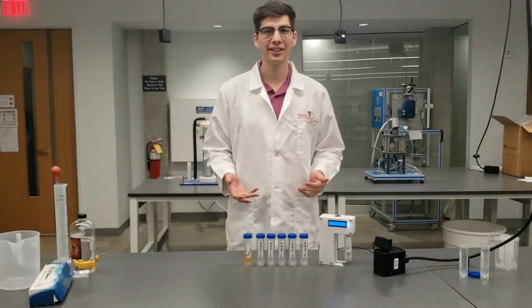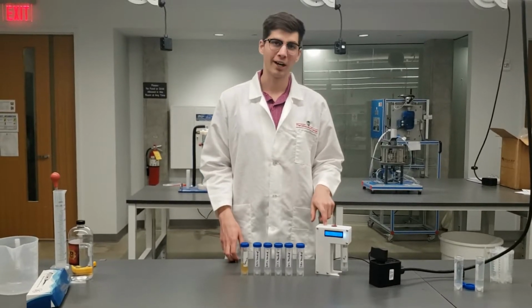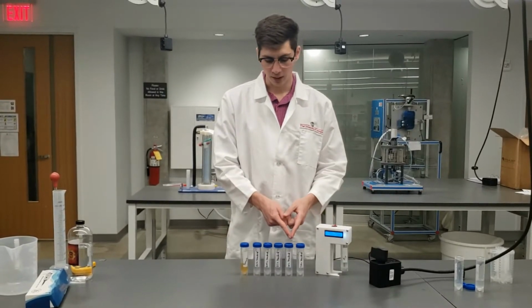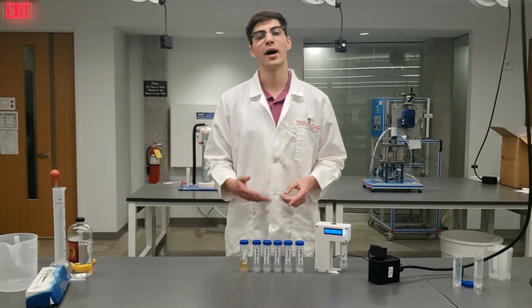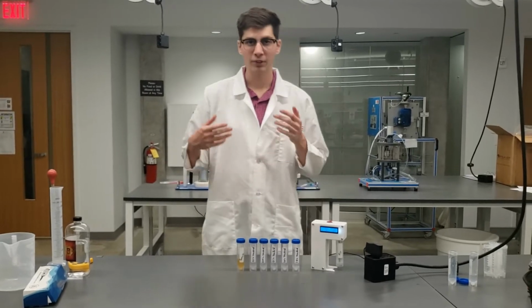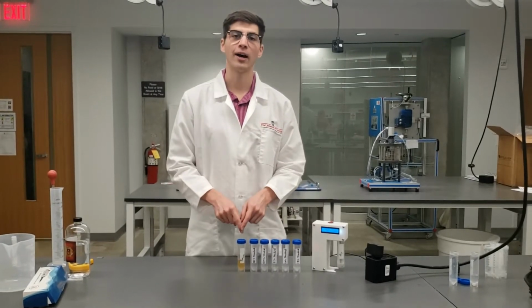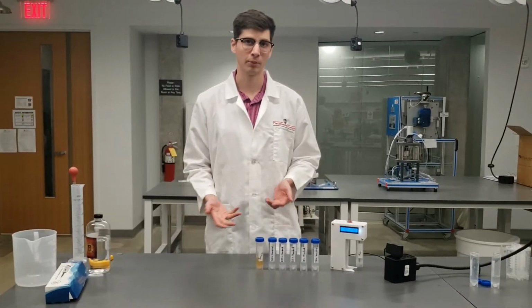So the things that you'll need in order to prepare your own calibration curve is, of course, the alcohol percentage detector. You'll need a variety of different alcohol percentage standards, and I go through how to perform dilutions like this in another video that you can watch. And of course, the end goal is to find the alcohol percentage of your unknown sample or multitude of samples.